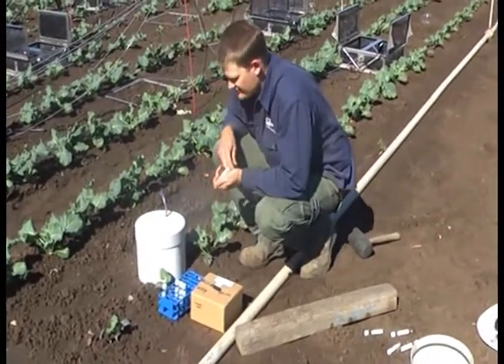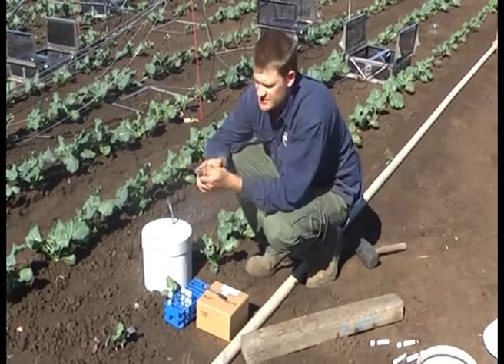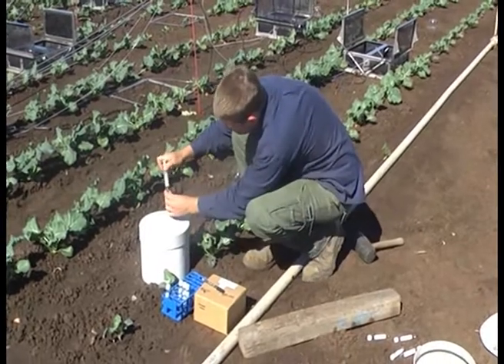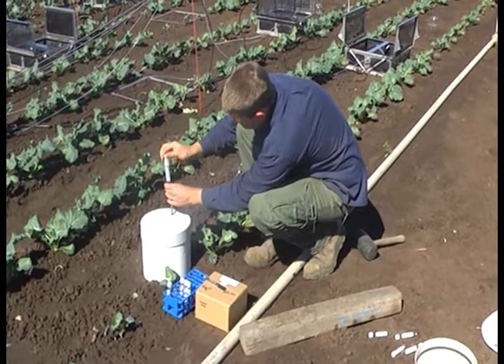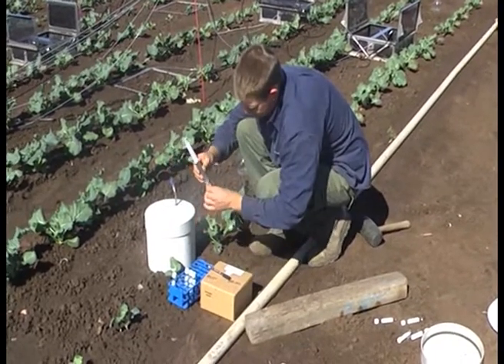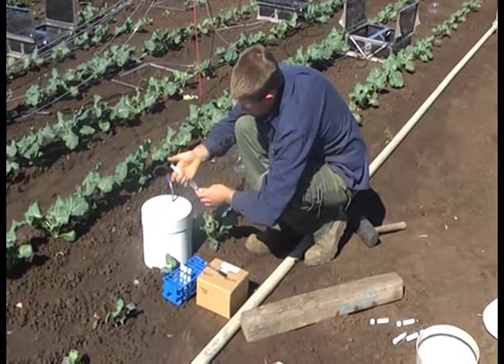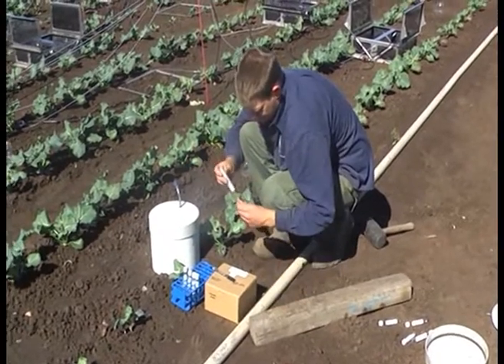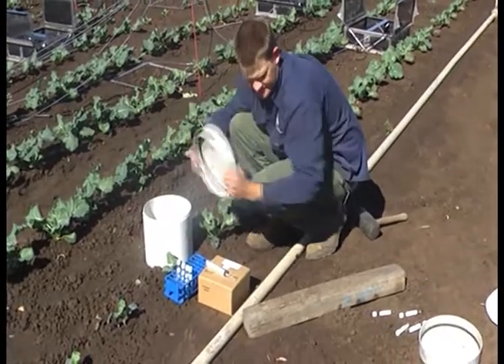Okay, so now it's been one hour — we're ready for our last sample. It's a good idea just before you take each sample to check that your syringe is not blocked. We do that by just popping it in and out. So once again we take our sample — we don't have to close the tap this time. And that's our sampling done. Now we remove the lid and that's done.